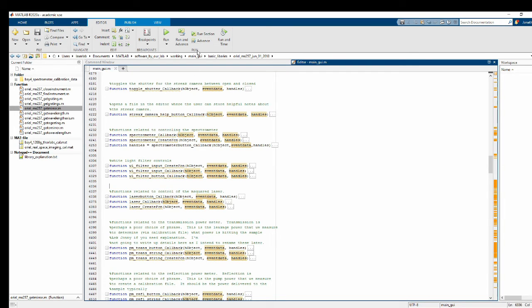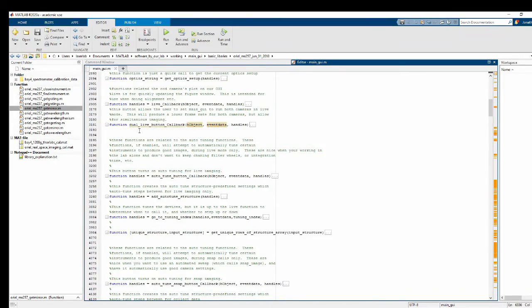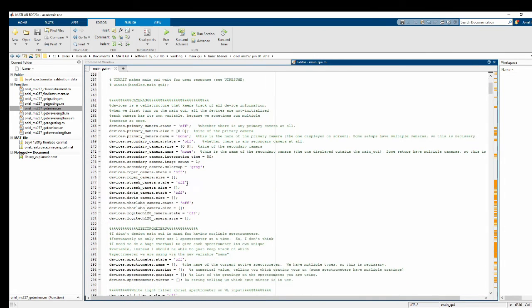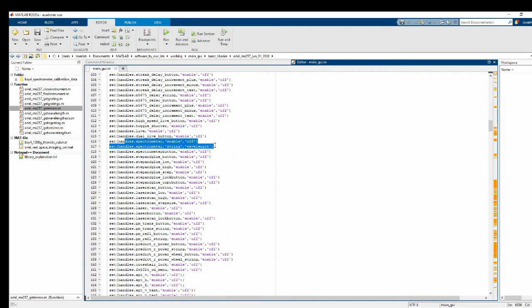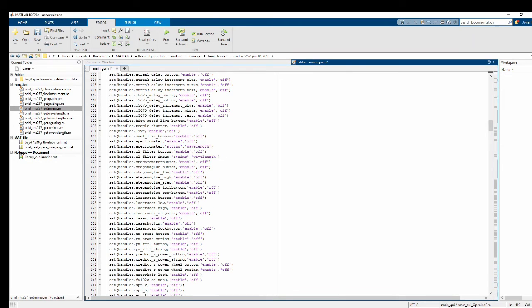All right. Now, the first thing we're going to do is make it so that those are disabled on startup, because until you initialize a device, you can't use any of its functions. So I'm going to go up to my opening function. And similar to all of these parts here, for example, down here, where I turn my spectrometer buttons on or off initially, I'm going to do the same thing here. Let me just copy the code I've already written. And you can see that turns off the white light filter button and the white light filter input.